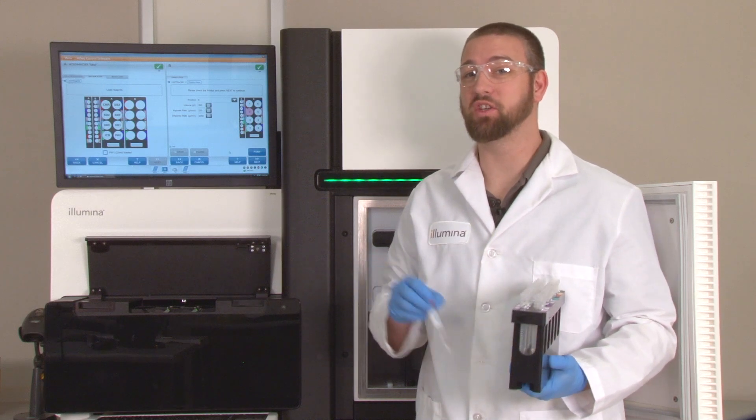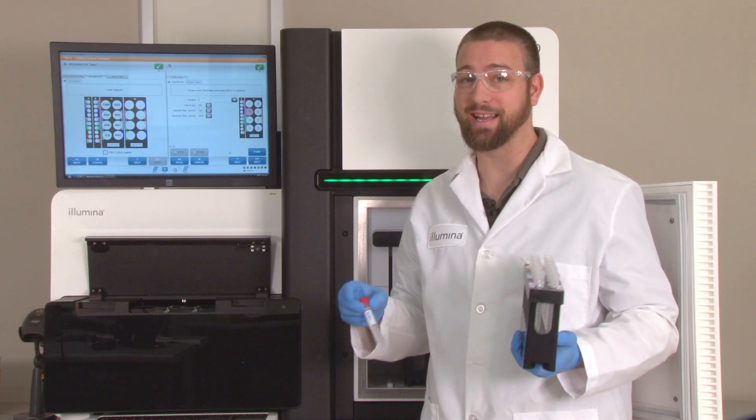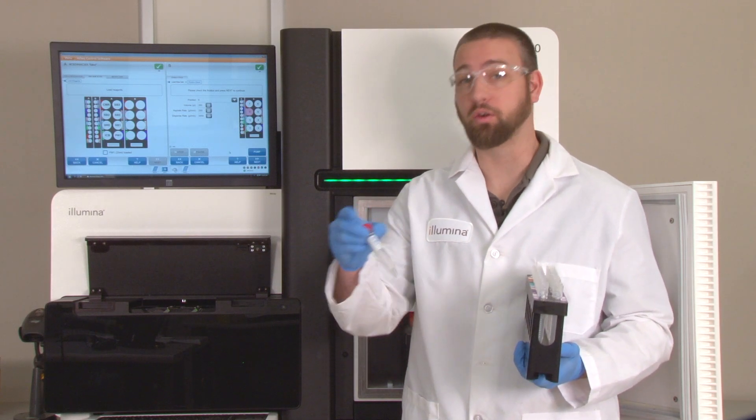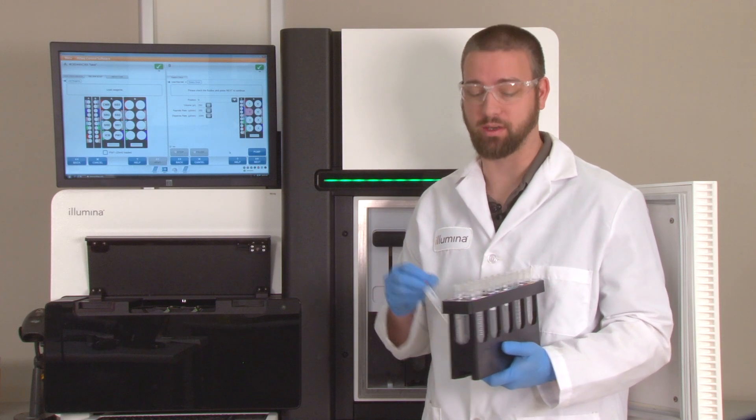The important difference here is that each of the two versions utilize different index primer site sequences, so the correct primer needs to be loaded into the HiSeq for sequencing.